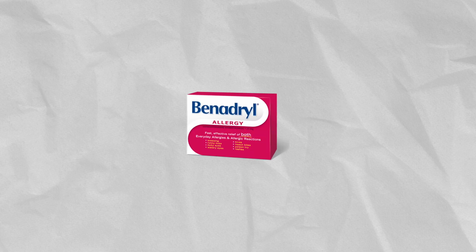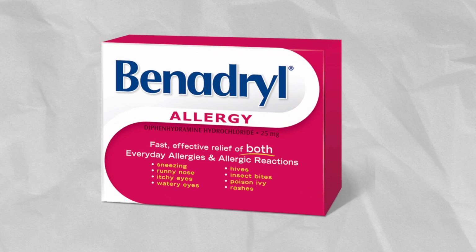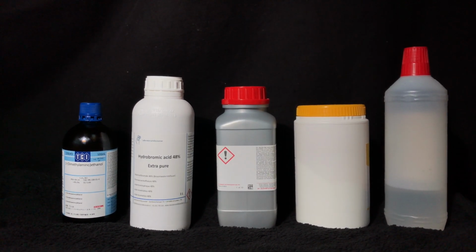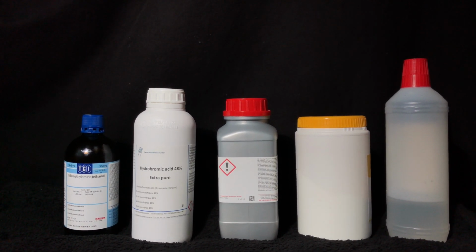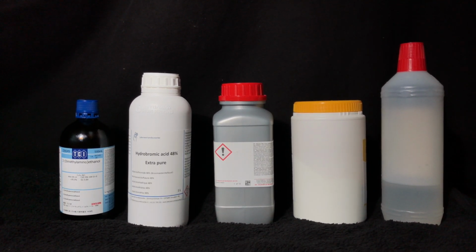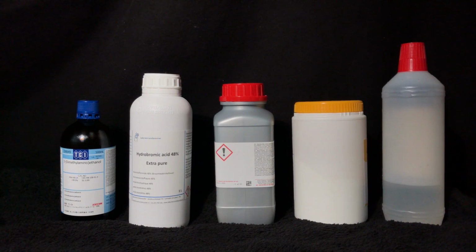Today we are going to make the main ingredient of Benadryl, which is diphenhydramine. Keep in mind that this is a failed preparation, so it didn't succeed, but I'll try it again. We need dimethylaminoethanol, hydrobromic acid, benzhydrol, potassium carbonate and distilled water.